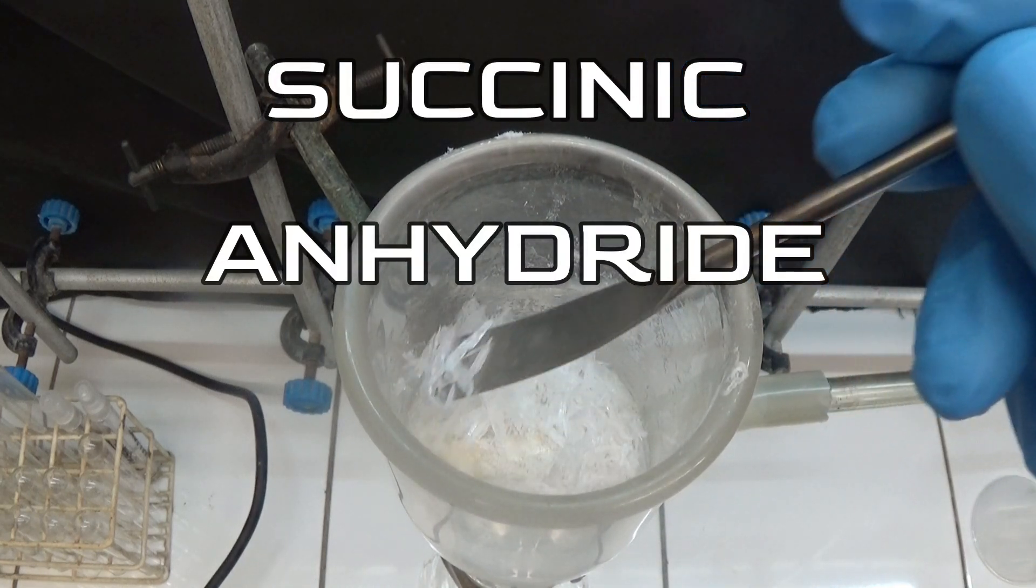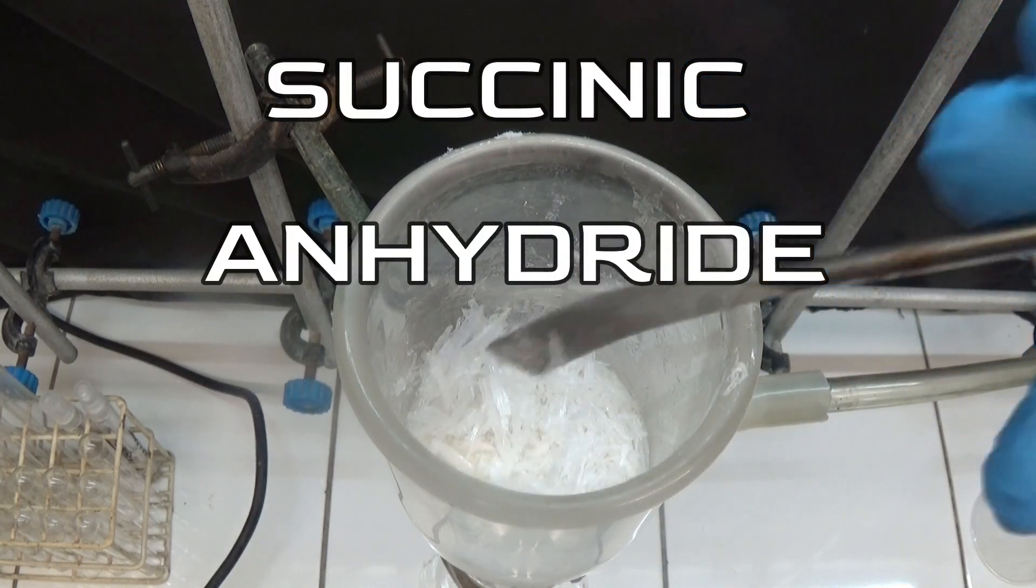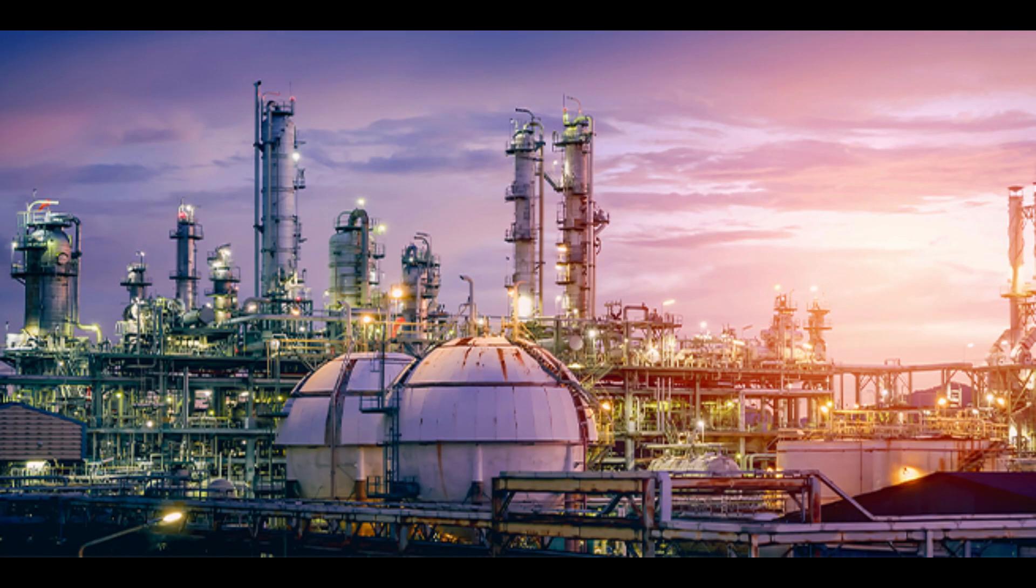In this video, we will learn how to obtain succinic anhydride. Succinic anhydride is a common substance in the chemical industry.